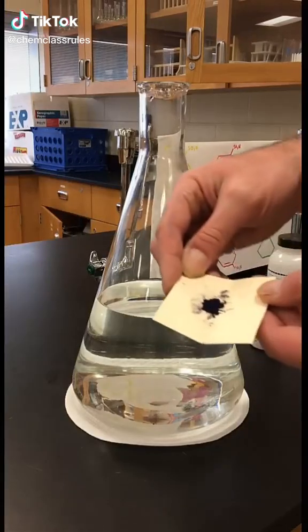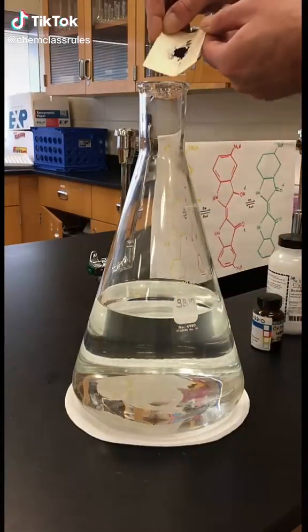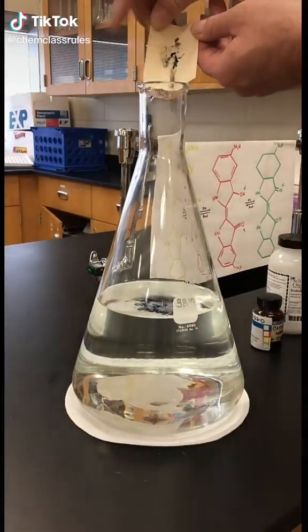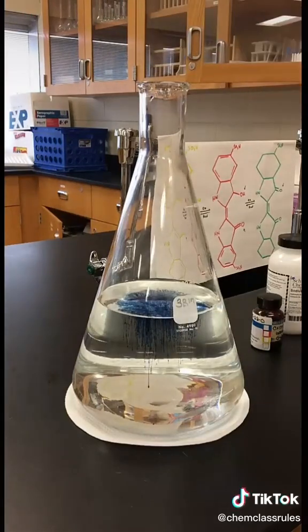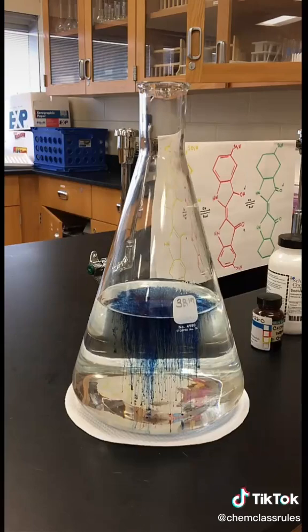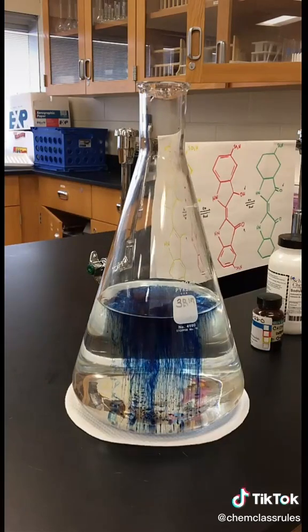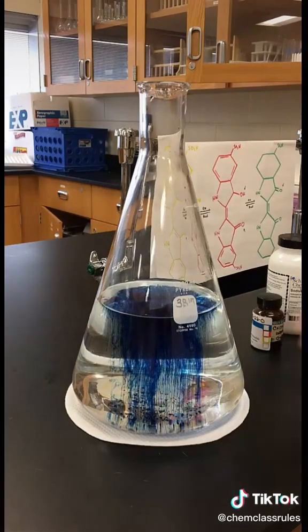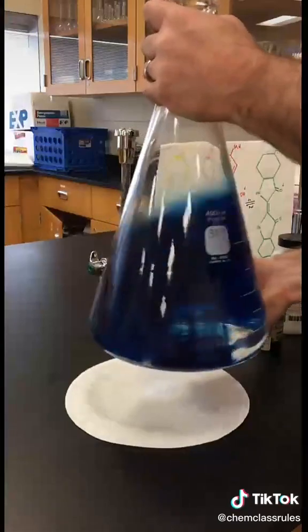Hey everybody, Chem Class Rules here. Today we're going to show you the making of the chemical traffic light. For this reaction you really only need four ingredients: water and indigo carmine, which I just added to the flask there. Indigo carmine is a blue food dye and it's also an acid-base indicator.